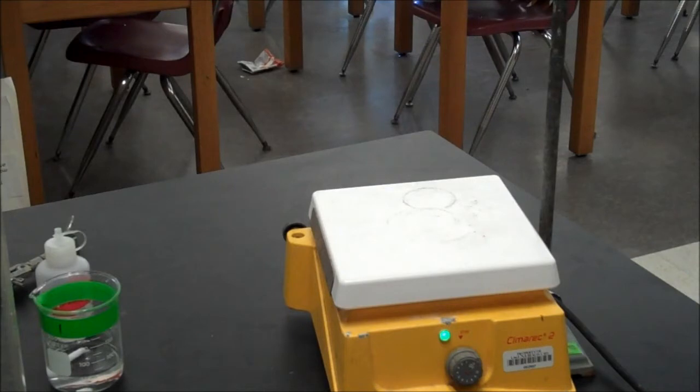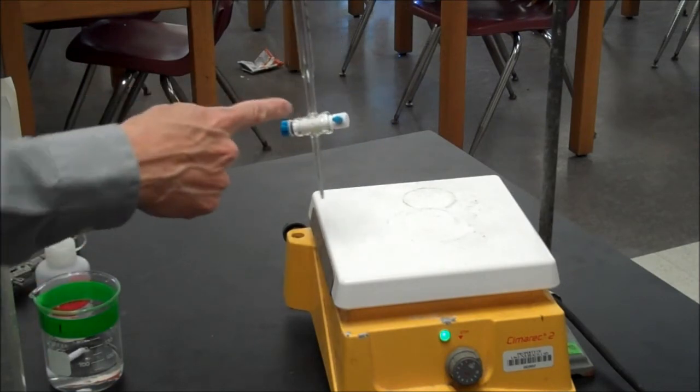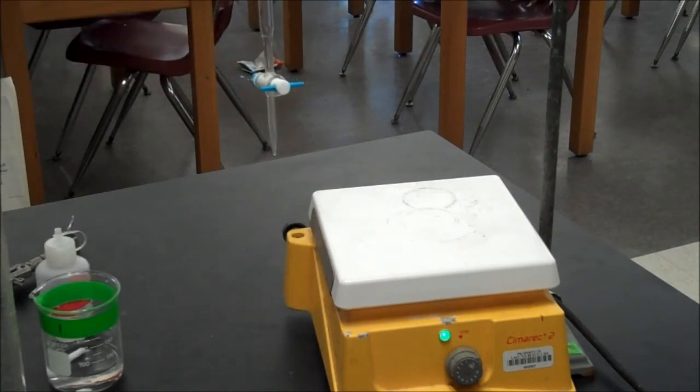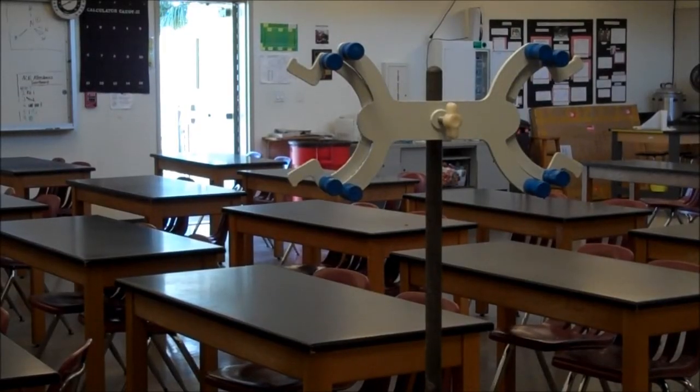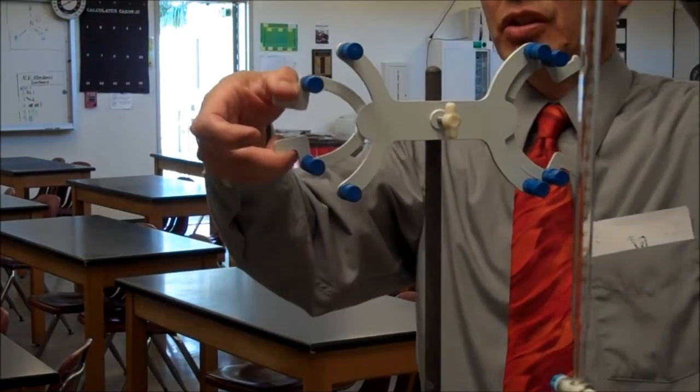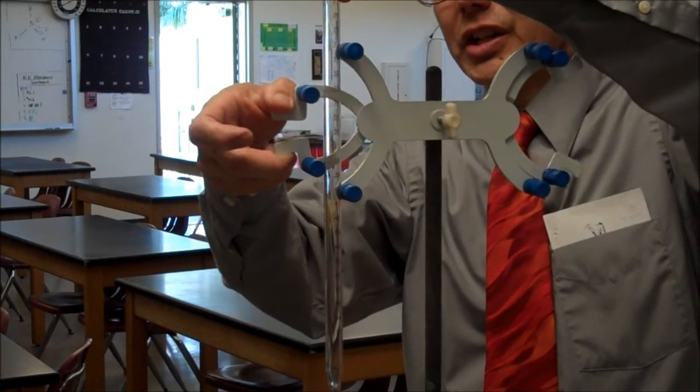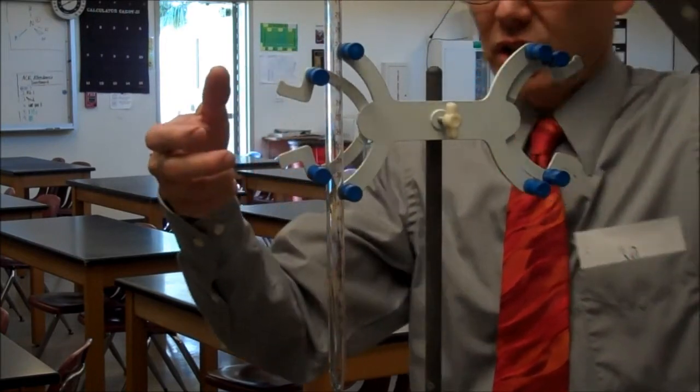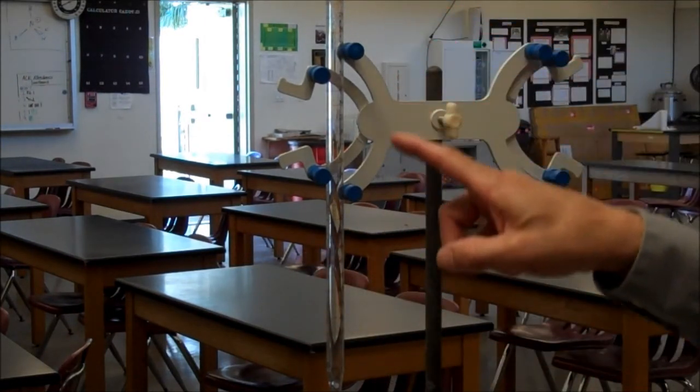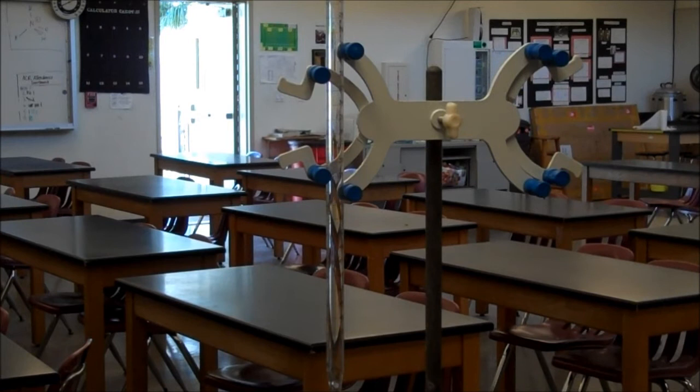The next step is to set up a burette. So a burette is a very long tube with a valve at the bottom and it's got markings on the barrel of the tube that tell me precise volumes, very precise volumes. The burette goes into the special clamp here. I am opening the clamp. I am placing the burette in here. I'm releasing the clamp. So it's spring-loaded. I need to be able to read the numbers clearly. That's how I'm going to set up my burette.